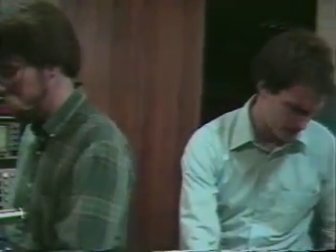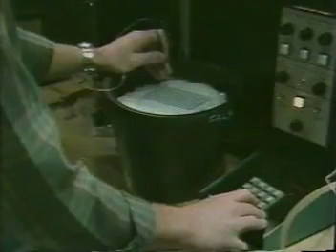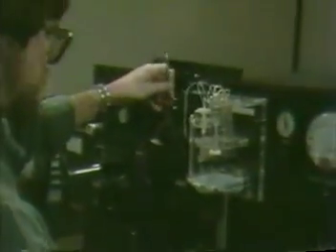Okay, we're finished collecting now. I wonder if we can move up to B3. Okay. That's an interesting pattern, actually.